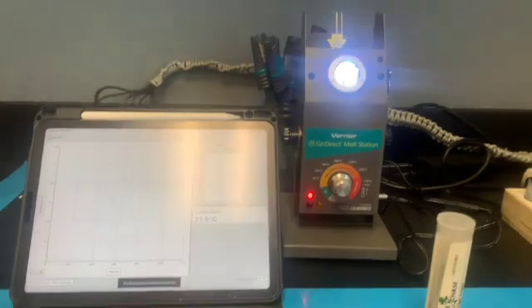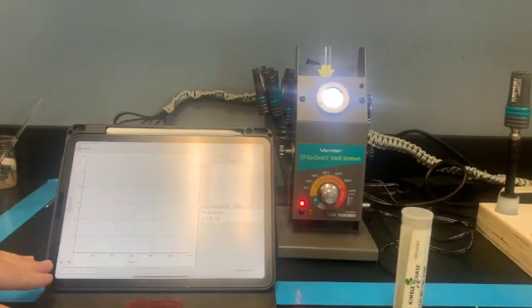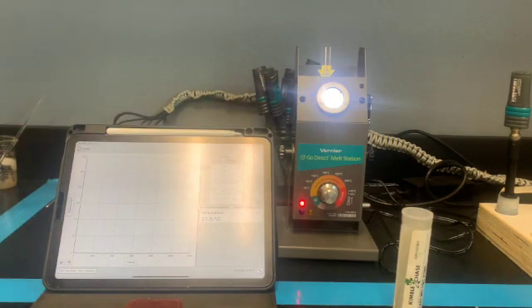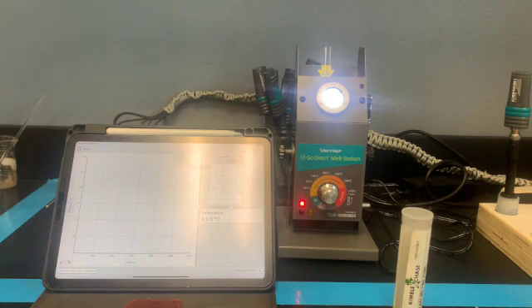And so now we're going to be sitting here for a little bit. We're letting it graph. We're going to be watching this eyepiece here, and when it finally starts melting, we're going to note what that is. Since I had two of them going at the same time, I'm going to have to really pay attention to when one starts melting, and then when it gets done melting, and then with the other one as well, okay? Or you can do one at a time. One at a time is going to take you a little bit longer. And that's the melting point station.